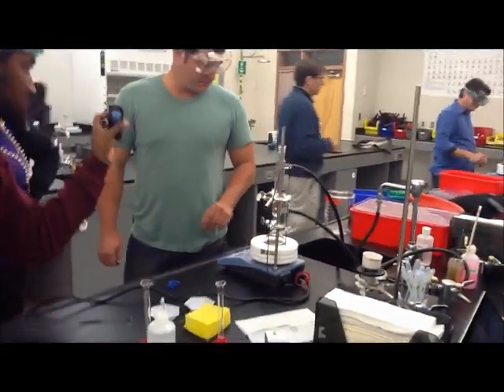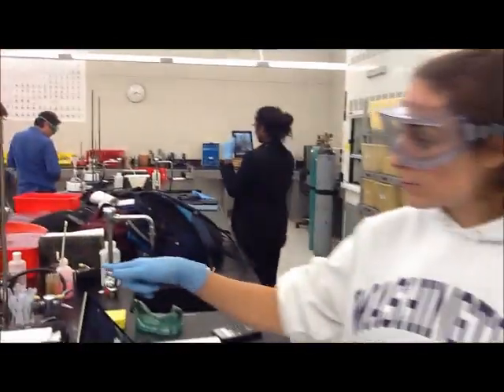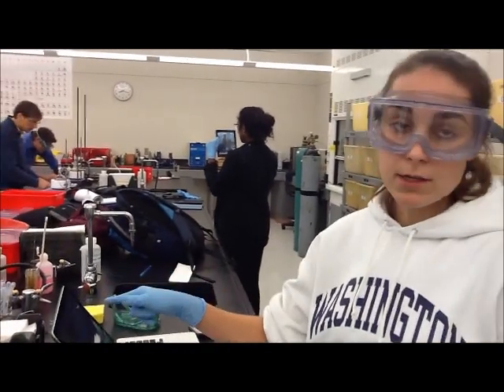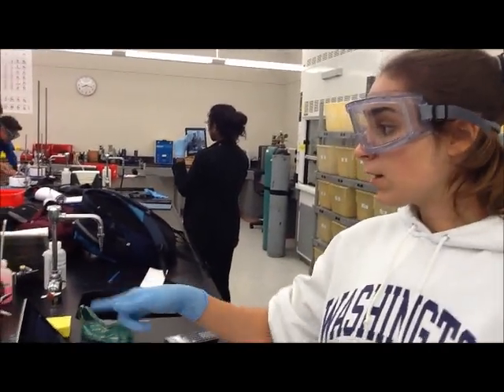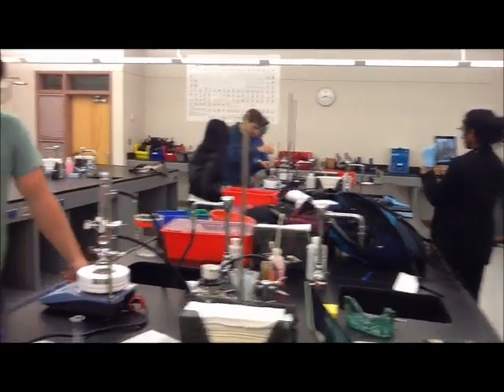Now we're going to reflux this for about 45 minutes. After it's dissolved, we added a little more isopropanol because it wasn't completely dissolving, and then we'll add the bromoethane when appropriate.